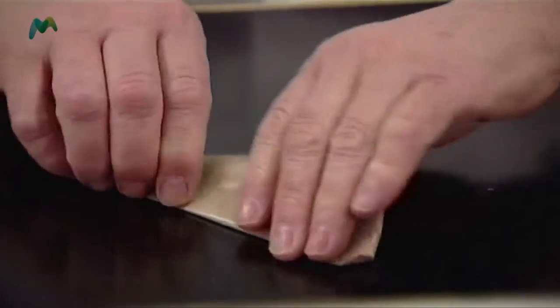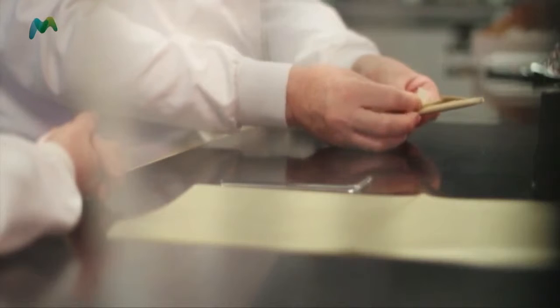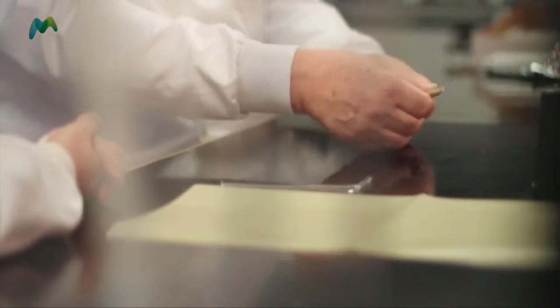Twist that bit in like that, and I'm now going to gently fold over once, twice, three times. I've got a little bit of autoclave tape here that I'm going to use just to hold that last piece of paper in place.